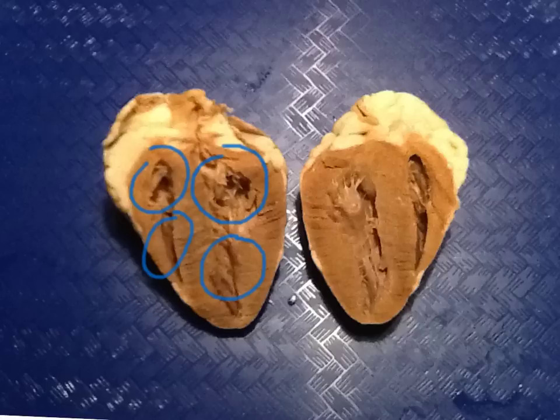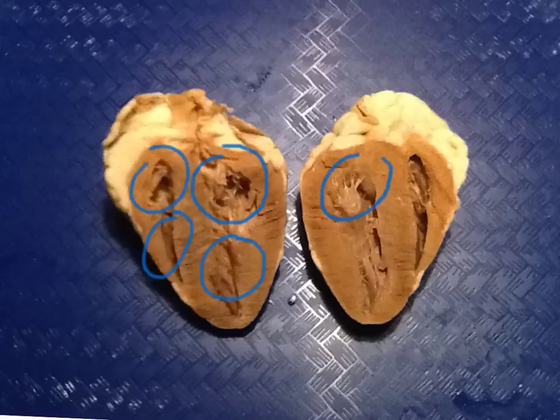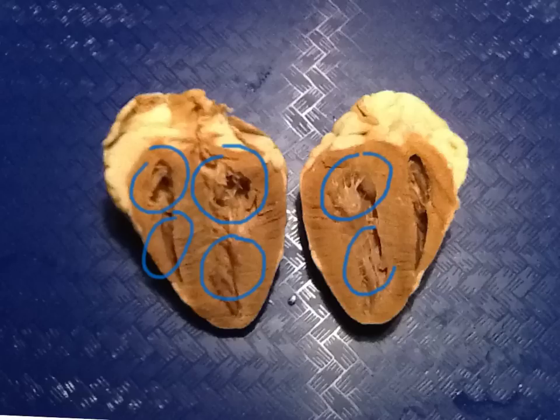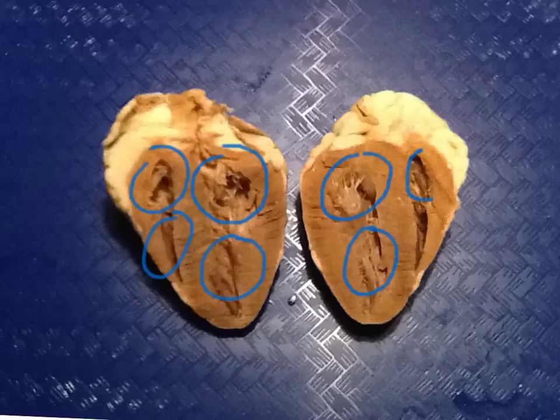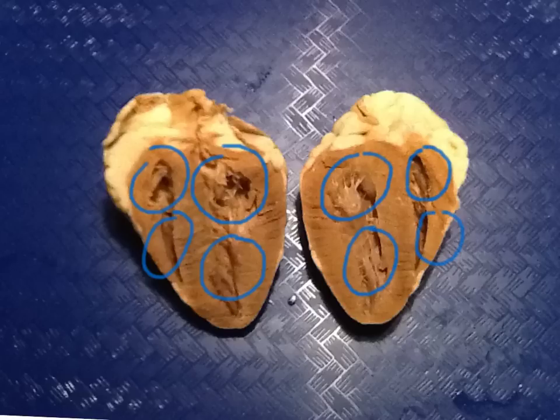The four chambers can also be seen on the other side: left atrium, left ventricle, right atrium, right ventricle.